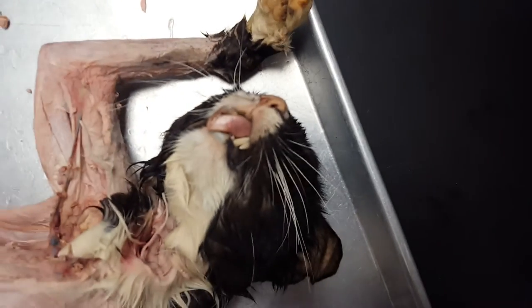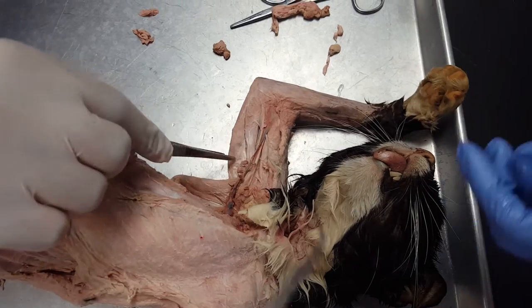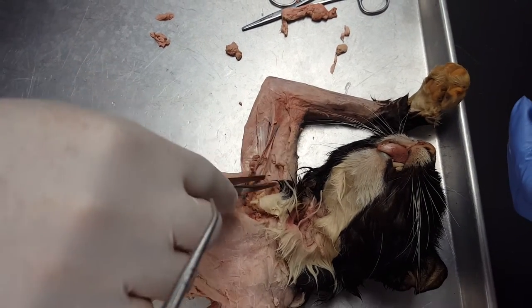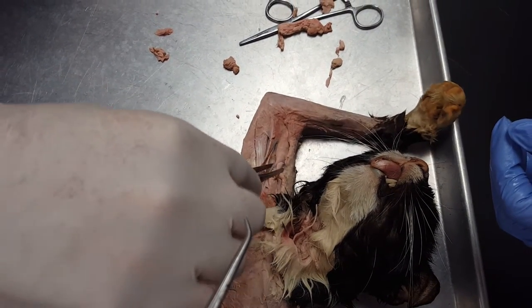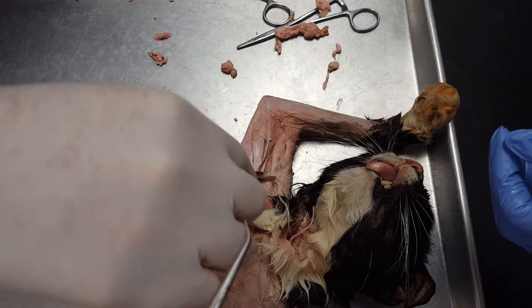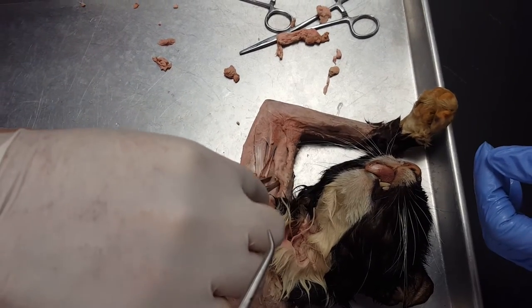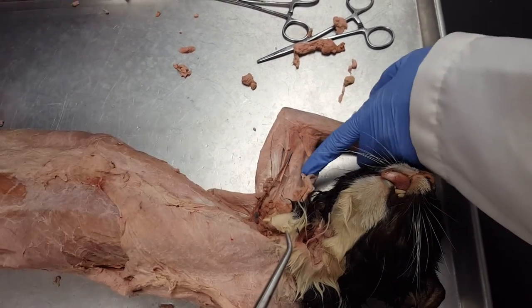Clavodeltoid is actually here. And then triceps — medialis, long head. This is your biceps brachii.